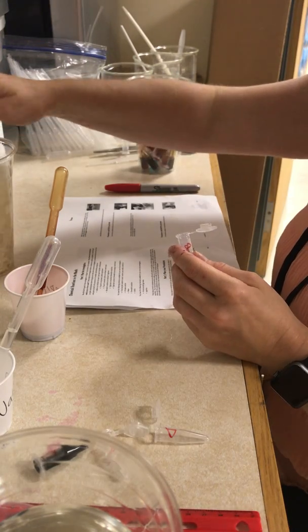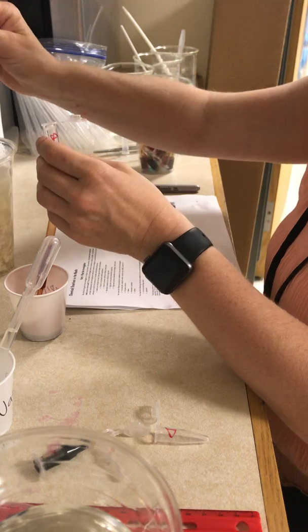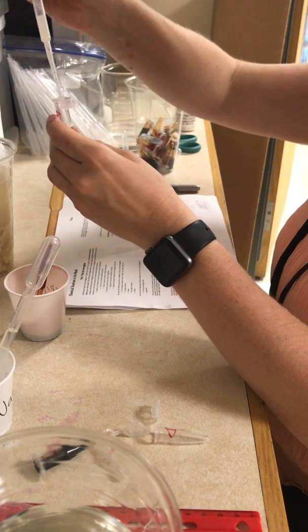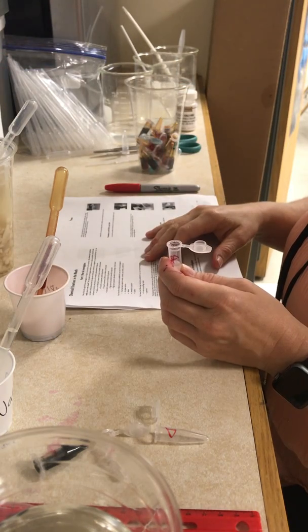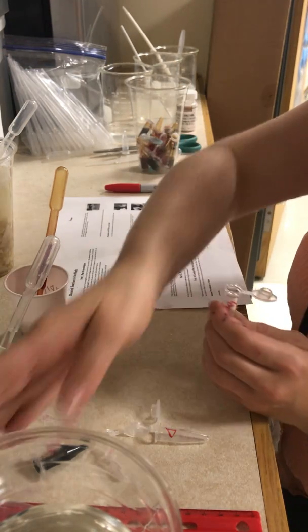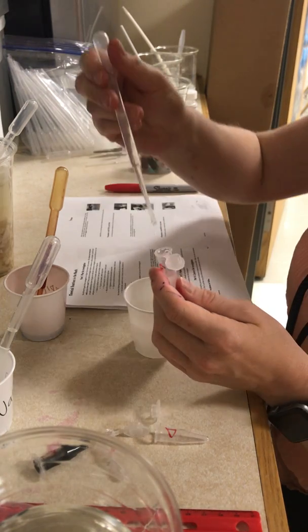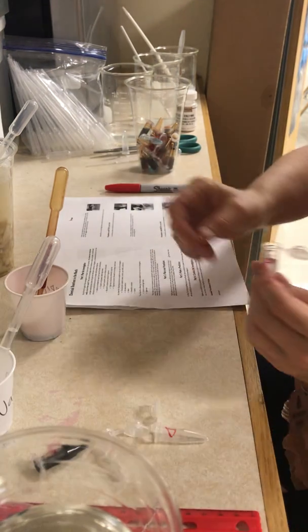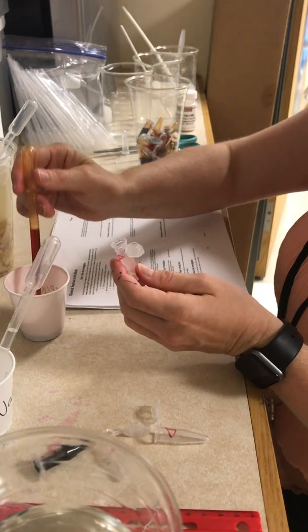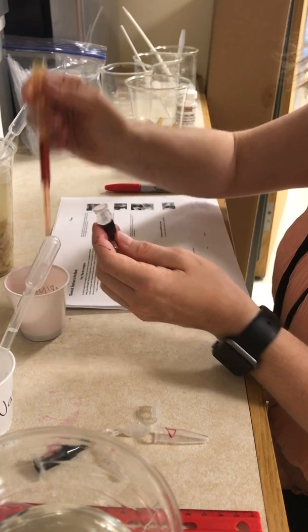For tube B, I'm going to follow a very similar procedure. I'm going to take the food and add 0.5 milliliters. This time, instead of adding water, I'm going to add the amylase solution — five drops, up to 0.5 milliliters. Then I'm going to add five drops of iodine, and then mix.